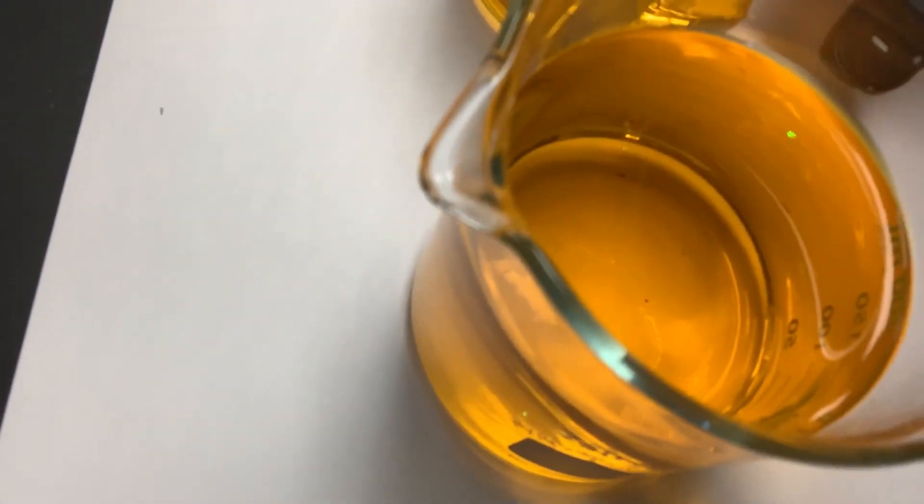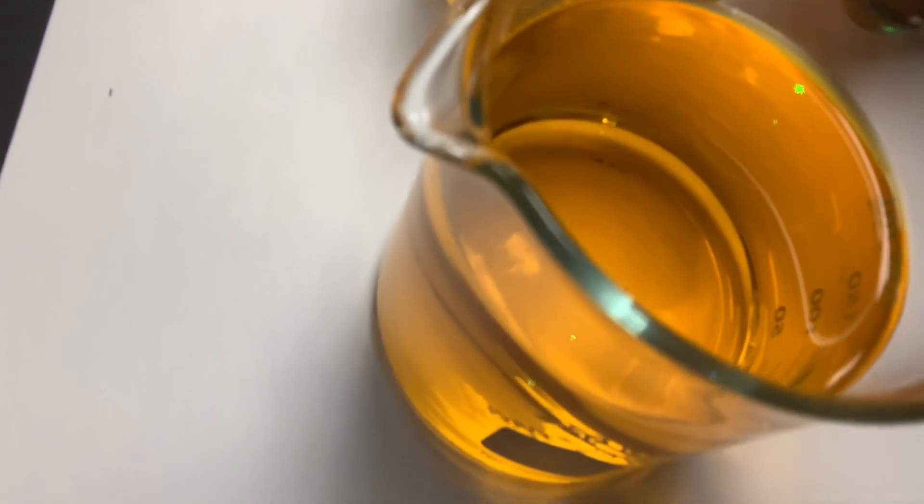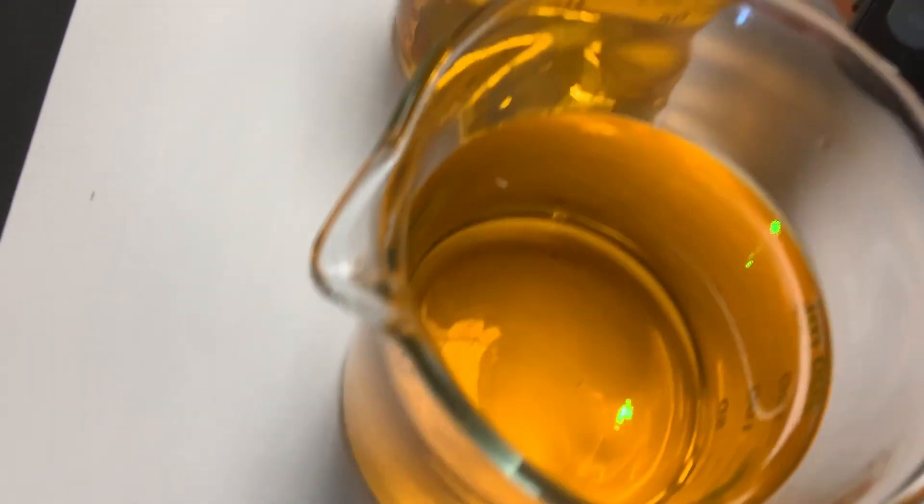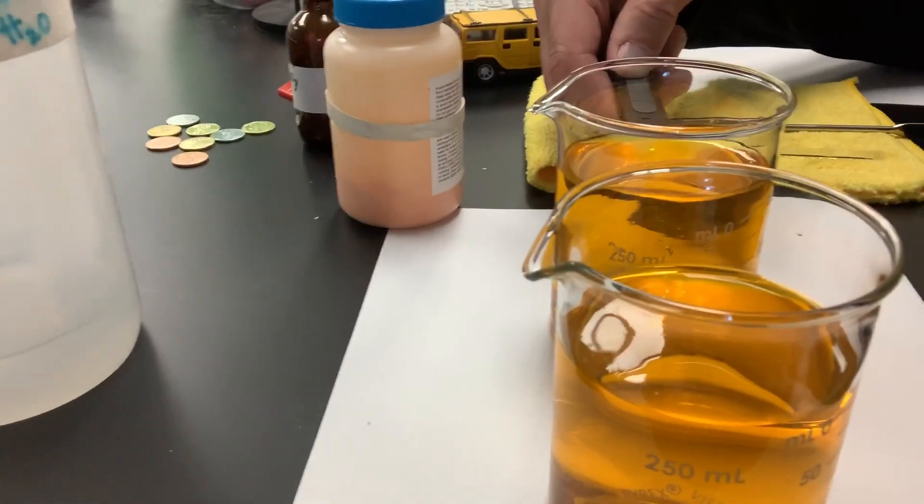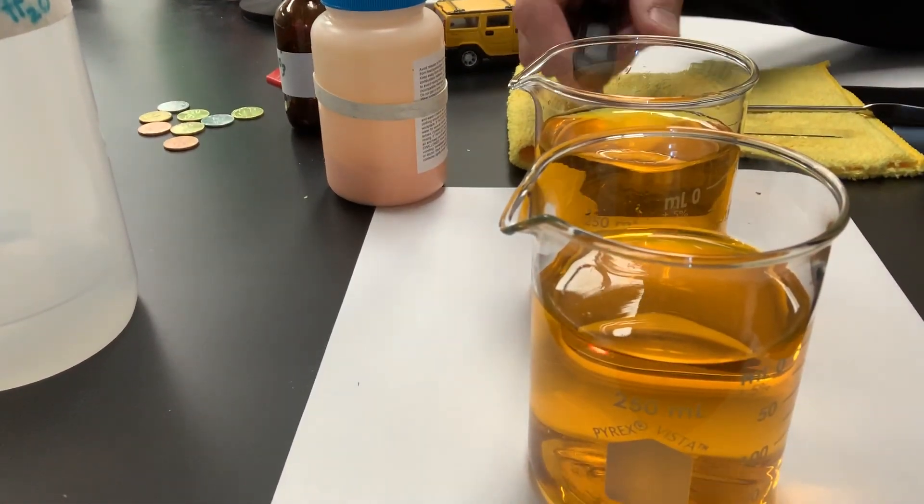And there is the second. I'll move my laser here. You cannot see the beam. I promise you, it's turned on, but you don't see a beam of light in those beakers. Now, this is called a negative Tyndall effect.